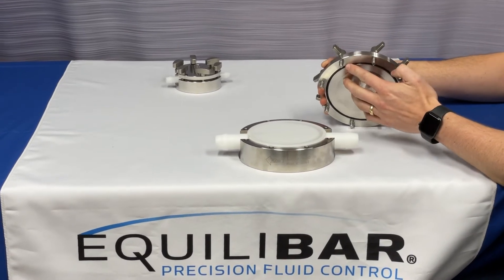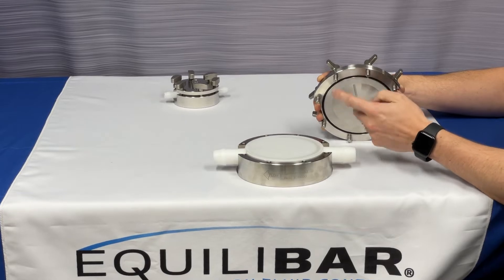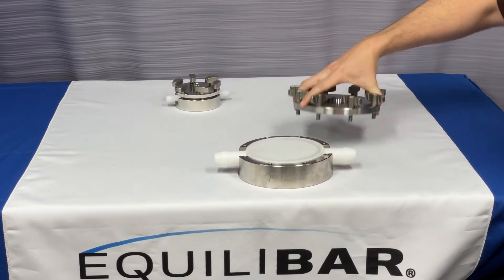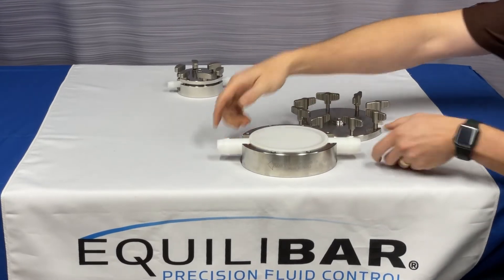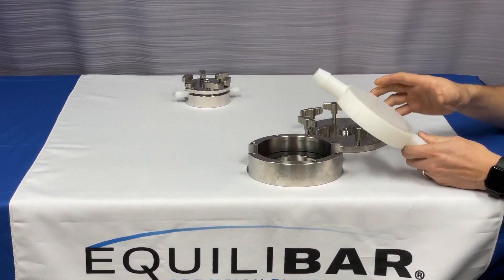The reference cap has a seated O-ring here for sealing the pilot gas. When you disassemble the valve, make sure that the O-ring is fully seated in the groove. To remove the polymer piece, simply lift it out of its cradle and dispose per your regulation.